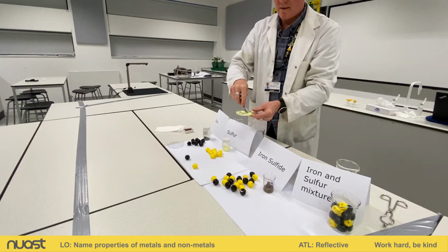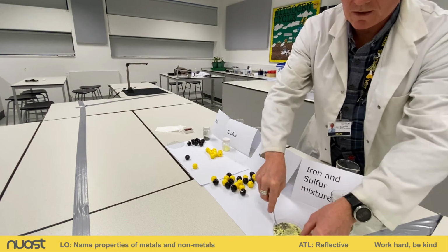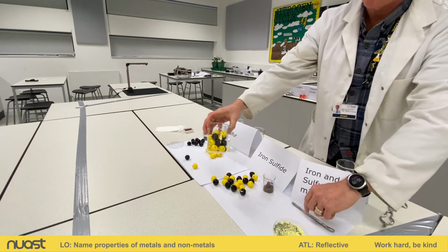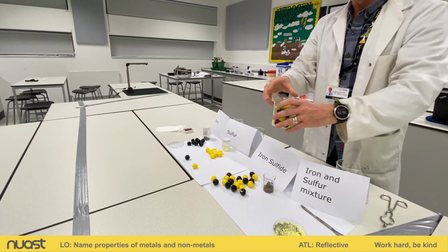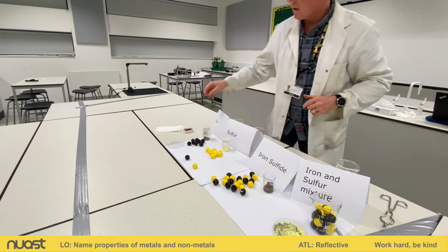So you can see, oh, there's a big lump of sulfur there. You can see our iron and sulfur has made a nice mixture there. And I have done a little representation of our iron and sulfur mixture here in this beaker with our yellow and black balls there. So let's see. All right, this is a mixture, this is our compound.